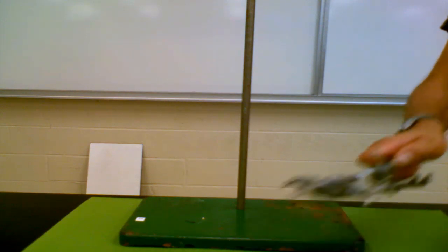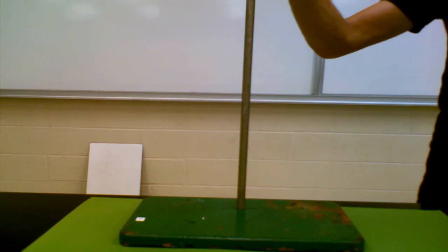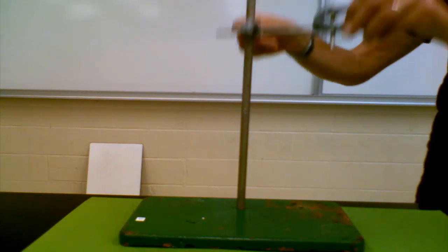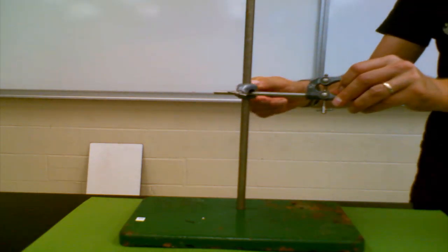First thing you should do is place your clamp on the retort stand like so.